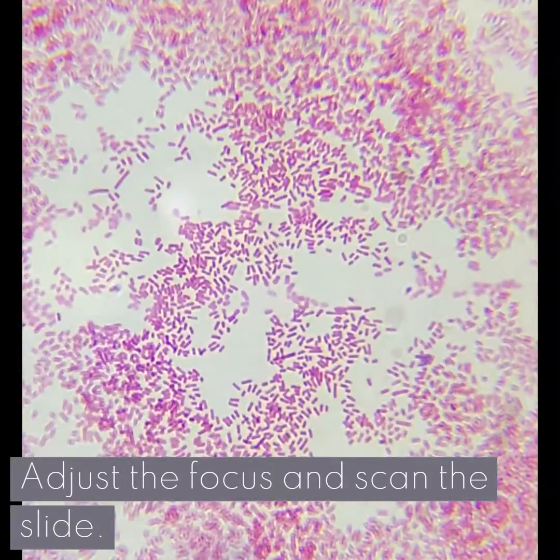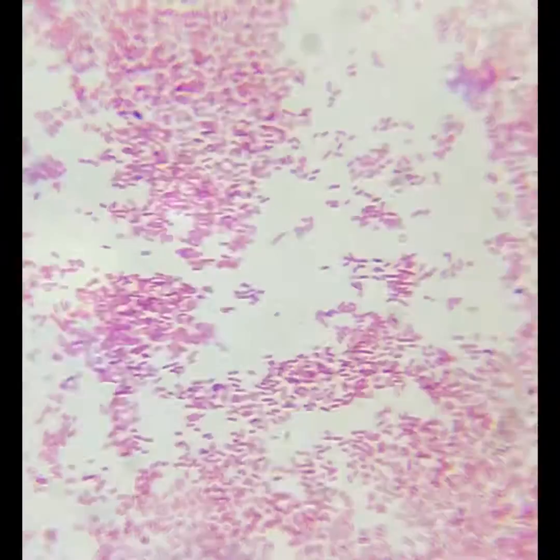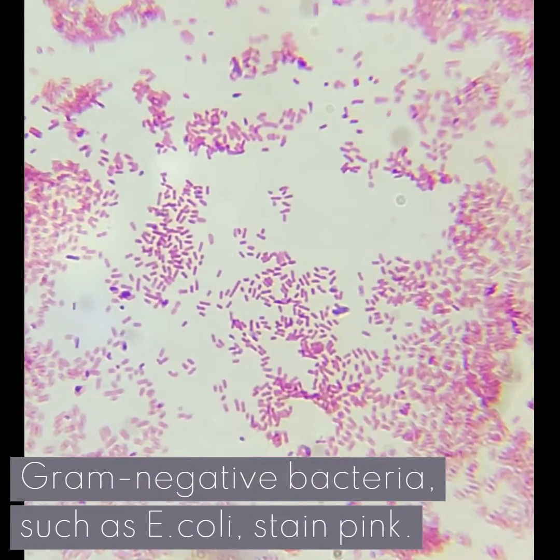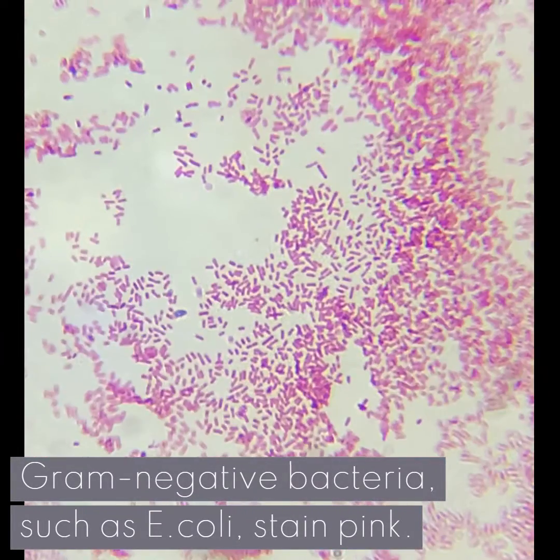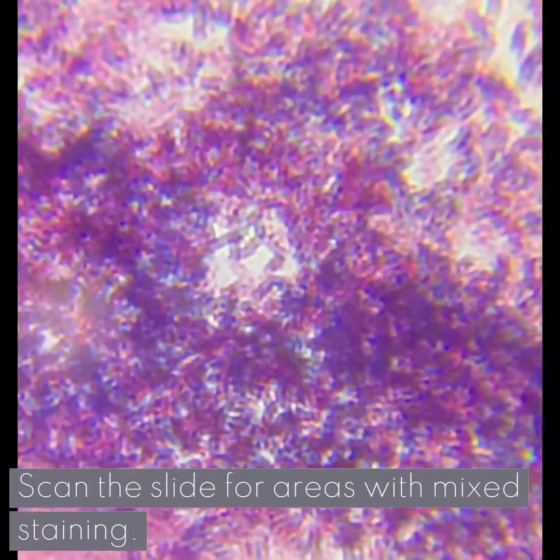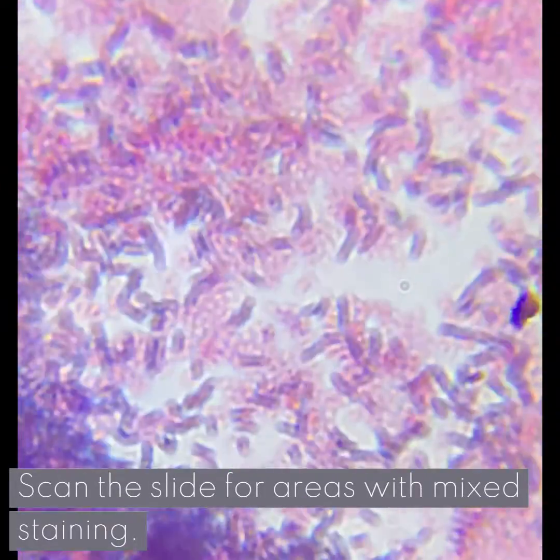Adjust the focus and scan the slide. Gram-negative bacteria such as E. coli stain pink. Scan the slide for areas with mixed staining.